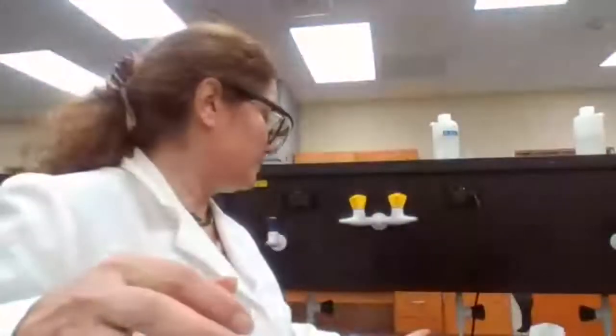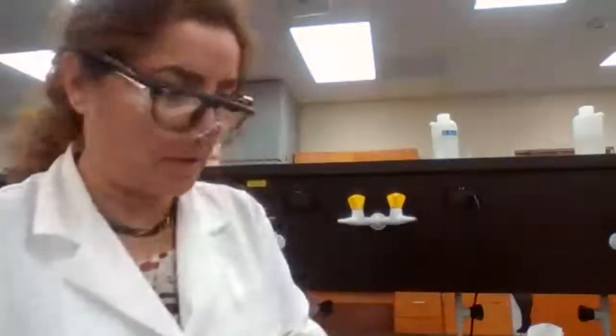Okay, we are going to measure the mass of the watch glass with the benzoic acid. You can take a screenshot.